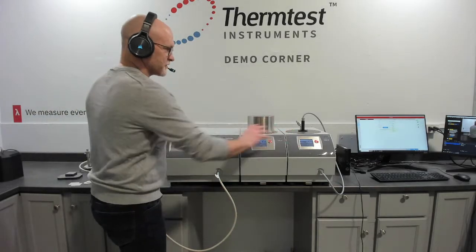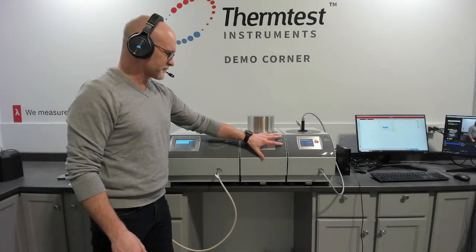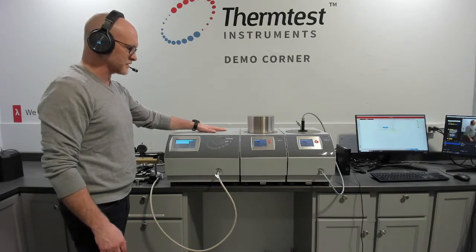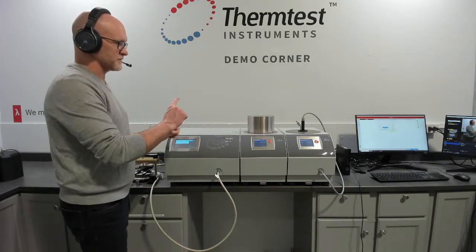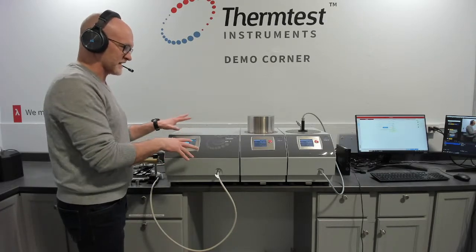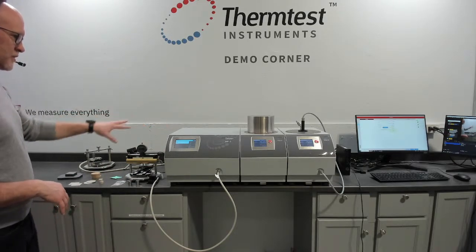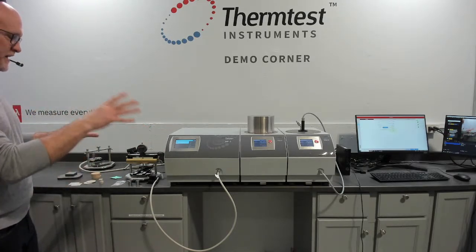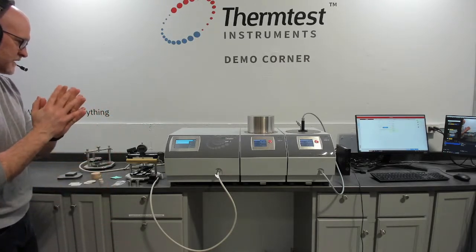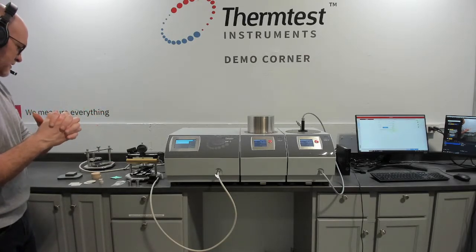So both of these methods, transient hot wire and transient plane source, the temperature platforms and room temperature sensors can all be operated from the same controller, and the software is smart enough to schedule all those different channels to take advantage of the capacity it has. So essentially the MP-1 is like having 4 controllers side by side with the ability to measure everything and control everything smartly.